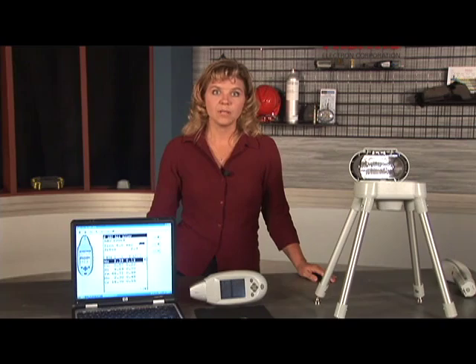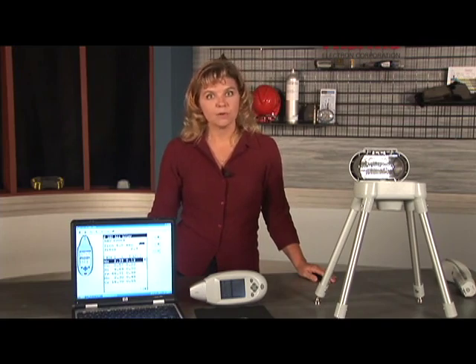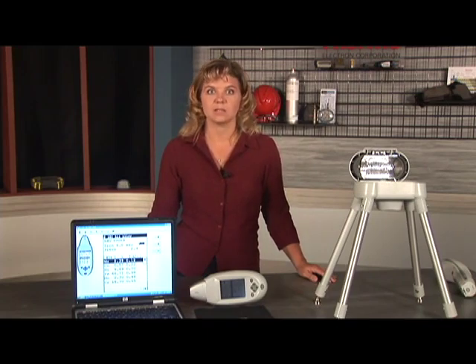An asterisk will appear next to any elements that are out of range. Alloy producers will typically use the minimum allowable amount of an expensive element in an alloy recipe and the maximum amount for inexpensive alloying elements. So do not expect all alloying elements to fall in the mid-range. In other words, don't expect a match number of 0 very often. Remember, the match number is based on comparison to the standard UNS alloy values in most cases.